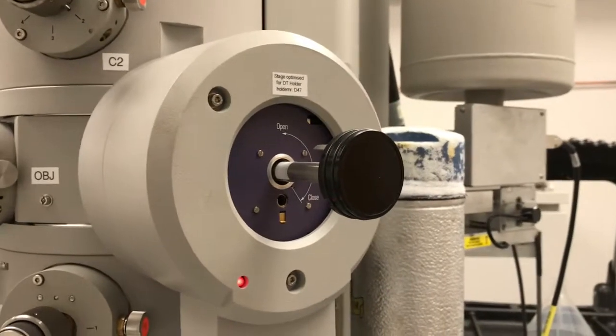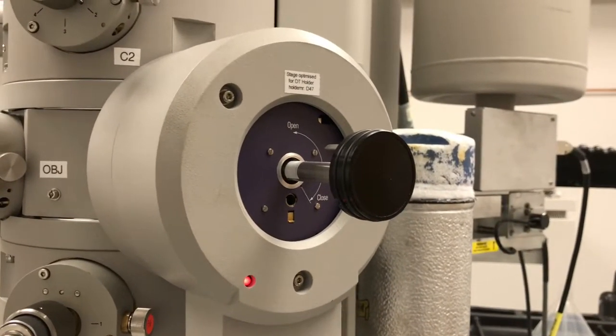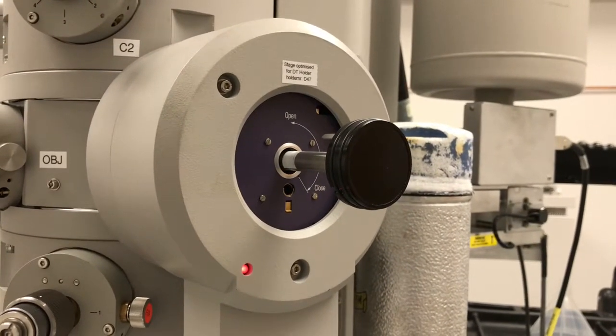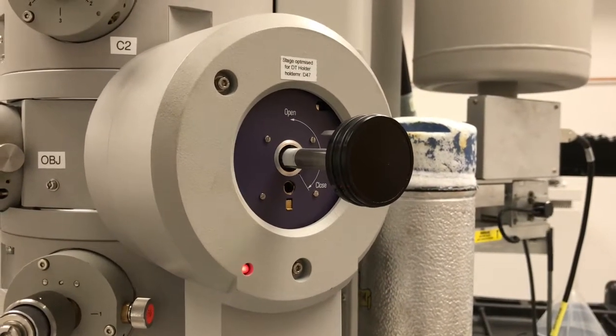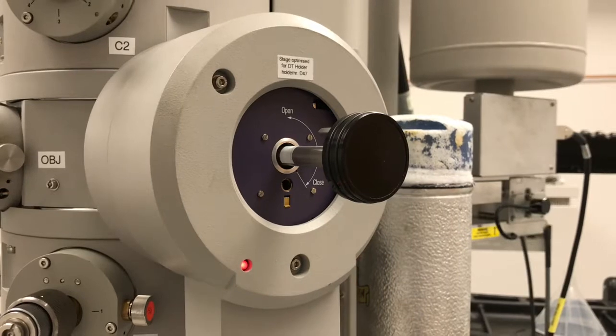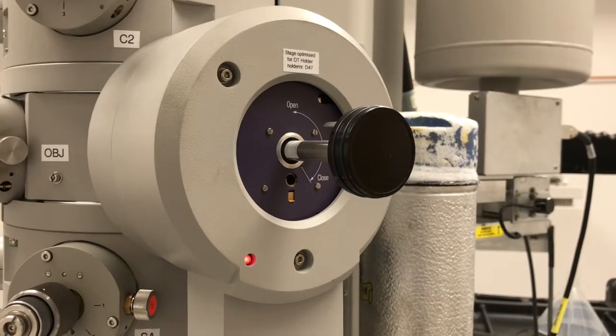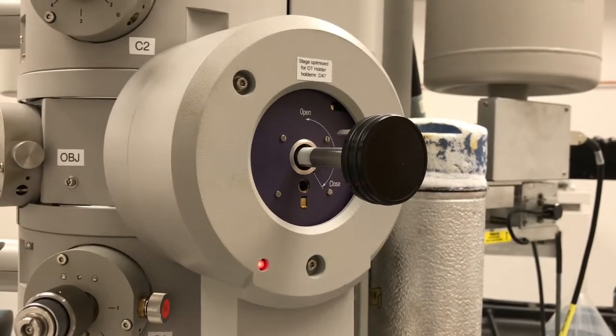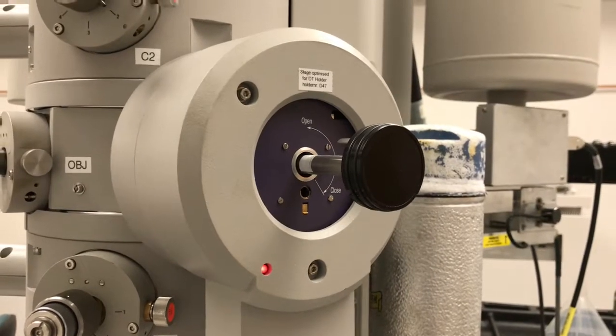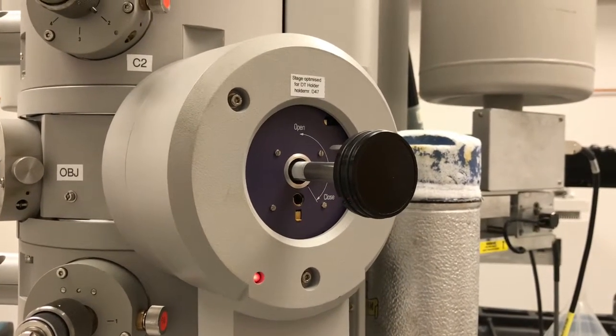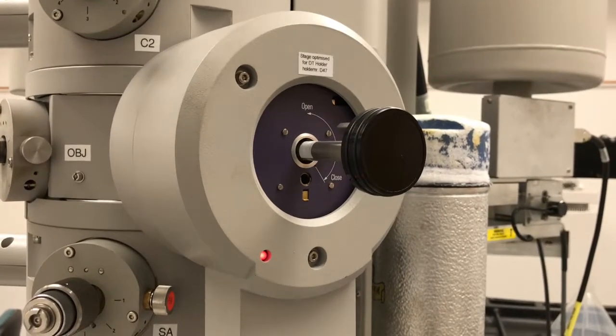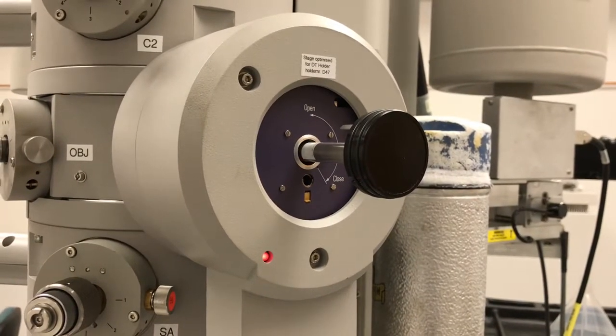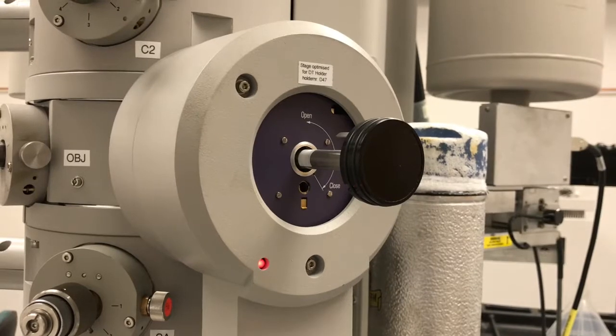This evacuation takes a minute. This can be configured to any time interval that you want on your particular system. In this particular system we have it configured to pump out for a minute, but I've seen systems where they pump out for two minutes. One to two minutes is usually sufficient. That of course is assuming your turbo pump is already on and running, which ours is. Obviously there's going to be a delay if you have to wait for the turbo to turn on.